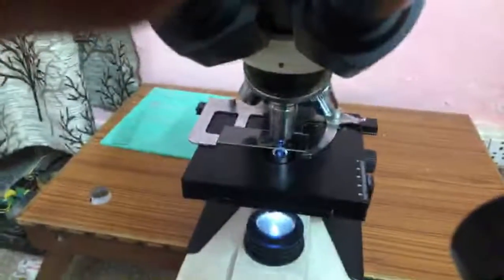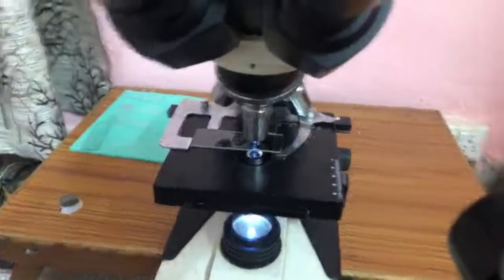So we are almost done. 1, 2. So it's pretty stable. Now I need to just bring it in close alignment and proper arrangement. Right, so it's almost through.